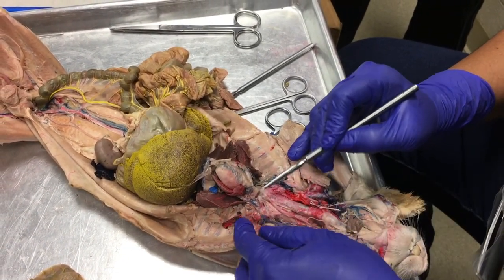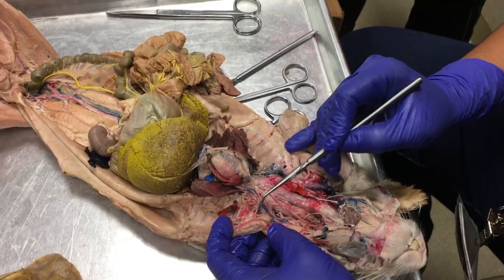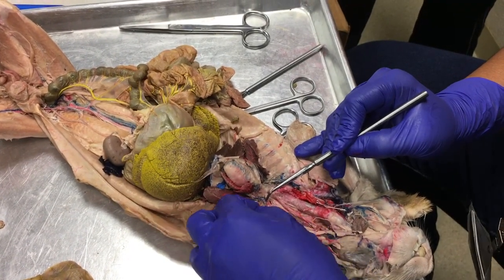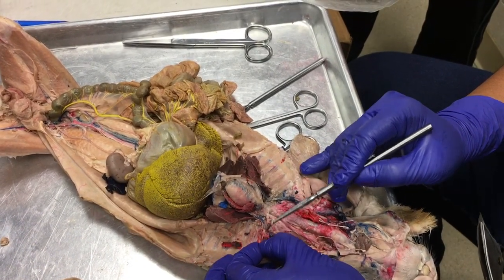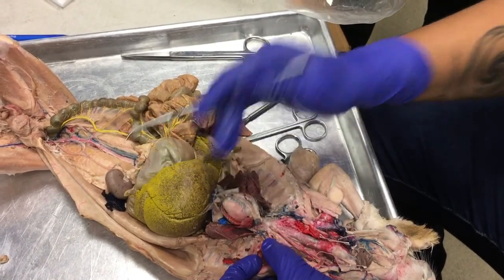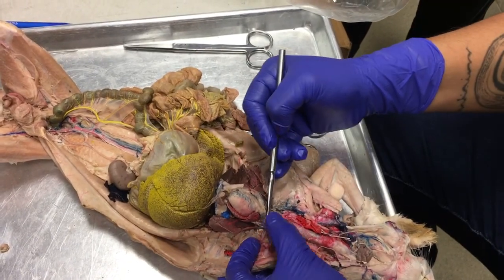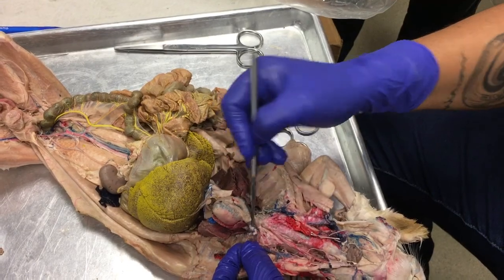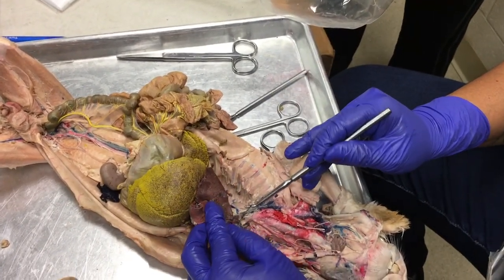Okay, on this side, let's see, no, that's subclavian, and it looks like it's broken right here. See the blue? Okay, so that's the internal mammary vein. And then if you look medially along this brachiocephalic vein, you're going to find a vertebral vein that's coming from the vertebral column. Okay, on there, it's on that side. Look at it on this side, it's really pretty.